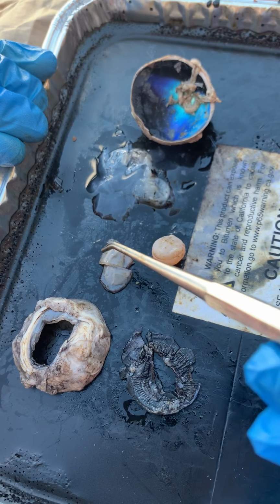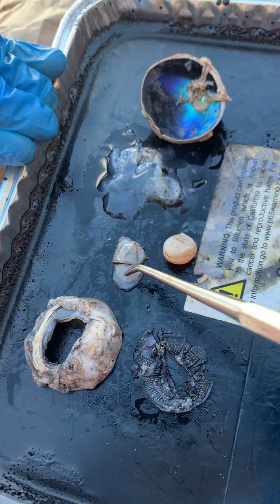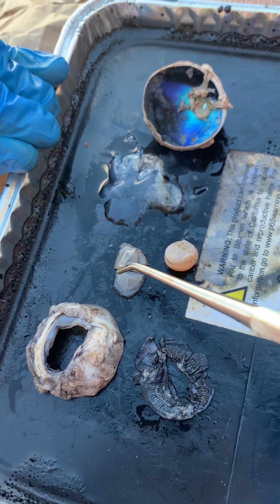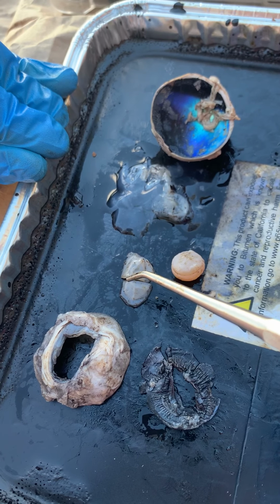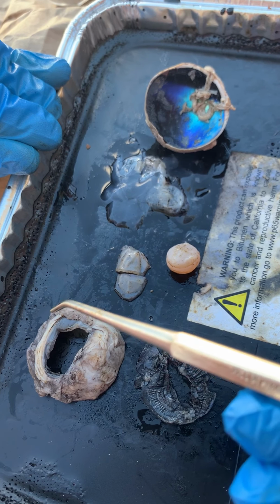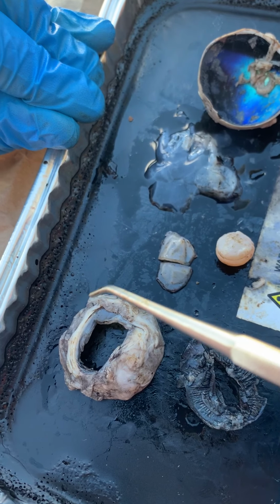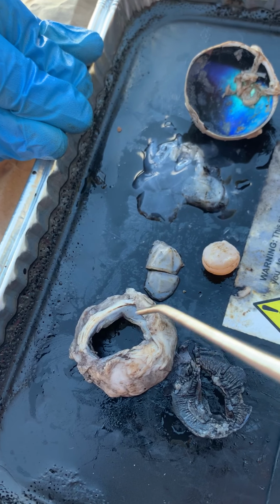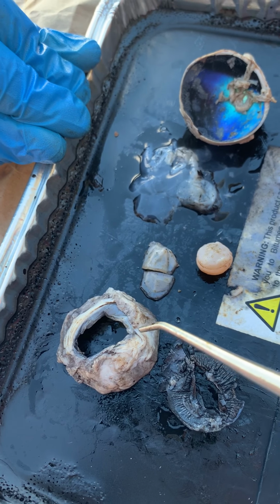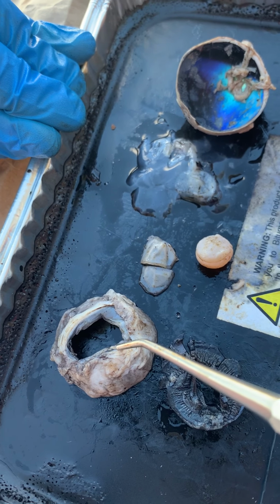So here we see the cornea is the most anterior portion of the eye where light first enters. The main function of this segment of the eye is for refraction of light. So outside of this, we have the surrounding portion of the cornea and the outermost part around the eye, and that's called the sclera, and that's normally continuous with the cornea, but we cut it out for this dissection. Here, the sclera offers protection and helps to form the actual eye itself.